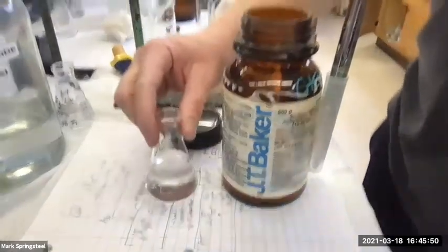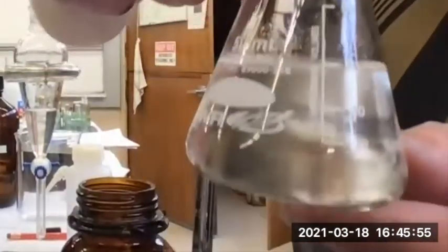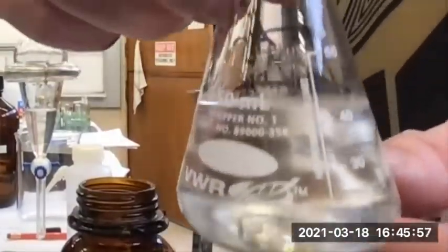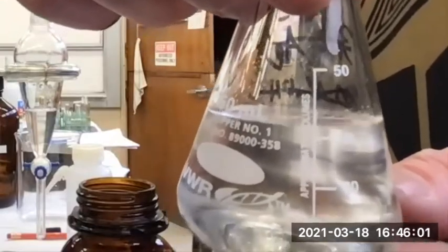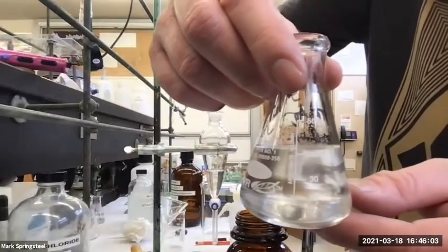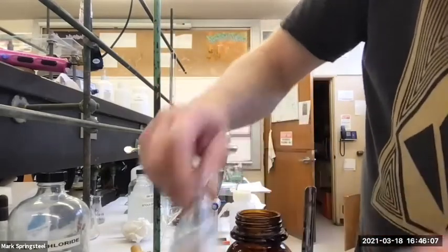And I think we could definitely see some, I didn't get all the water out. There's some beads of water in there. I don't know if it's showing up on your video. Do you see little beads of water floating in there? Yeah, sticking to the sides of the glass. You can see it on the side of the glass too. Yeah, good point. So you'll see that go away.